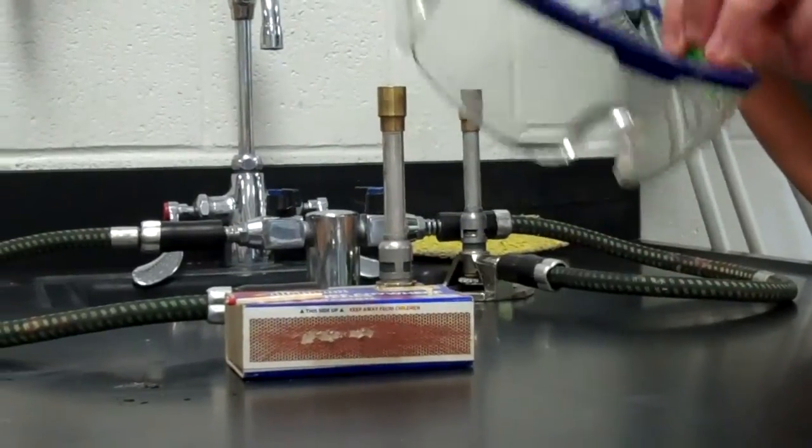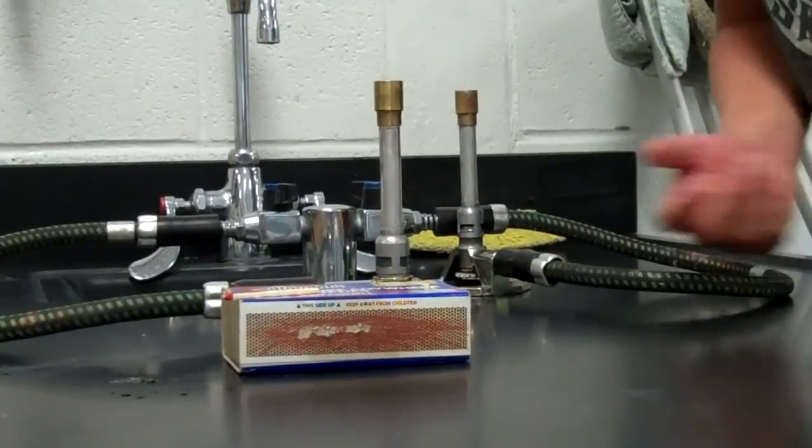When you first start lighting a Bunsen burner, you have to put your glasses on. If you don't put your glasses on, it can affect you.